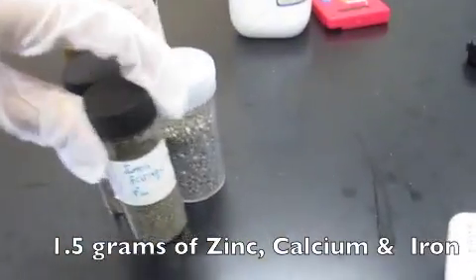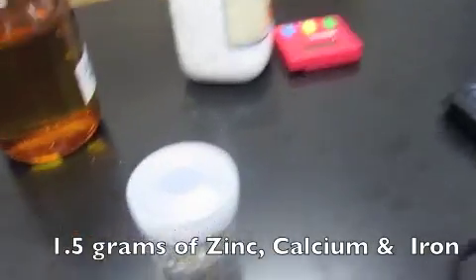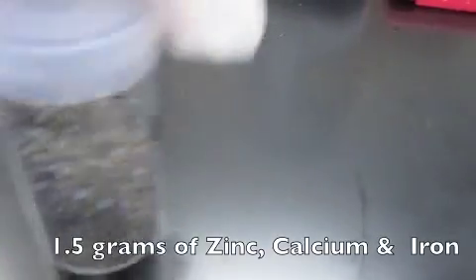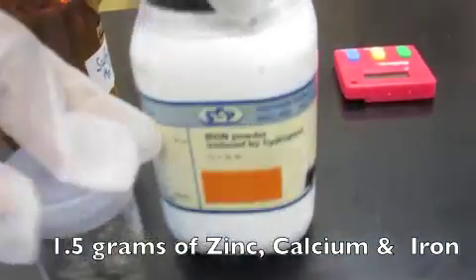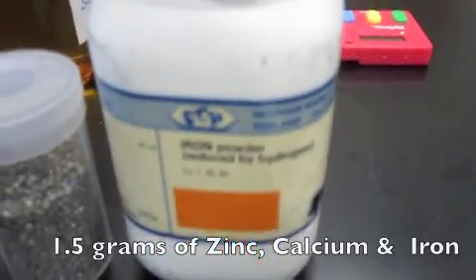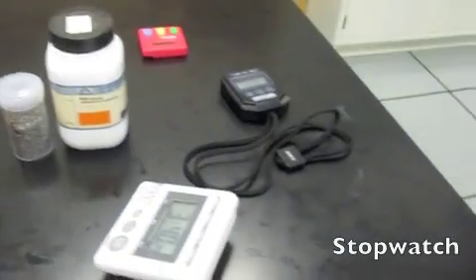We measured out 1.5 grams of powdered zinc for each trial. We also measured out 1.5 grams of calcium pellets for each trial. We also measured out 1.5 grams of powdered iron for each trial. And we also had a container of 6 molar sulfuric acid, string, and 3 stopwatches.